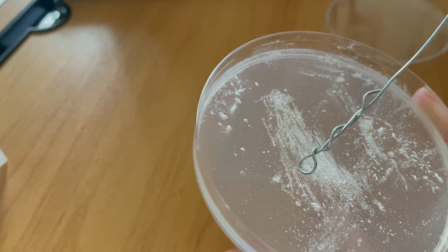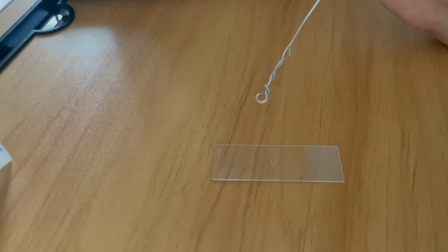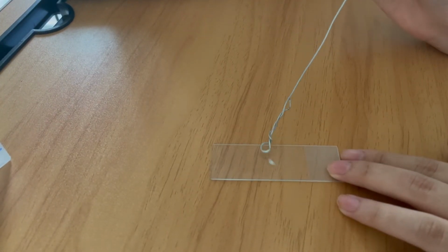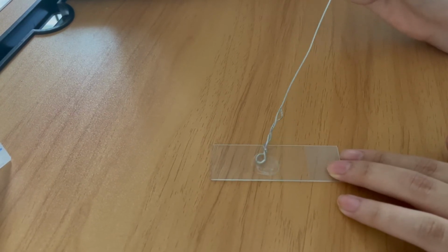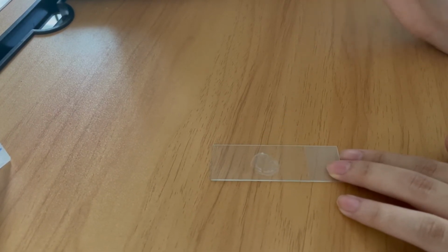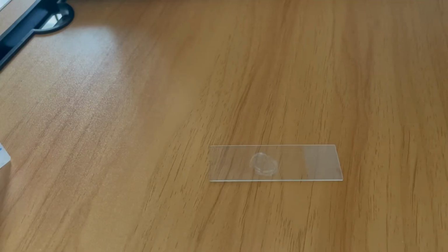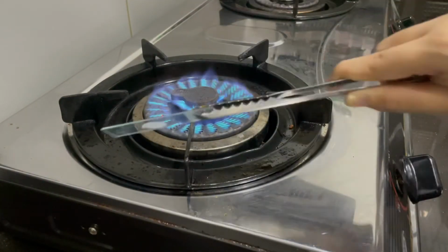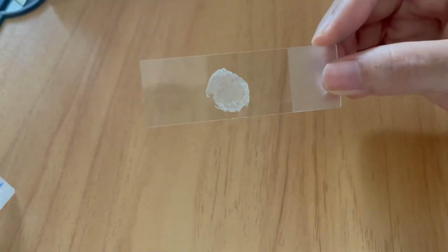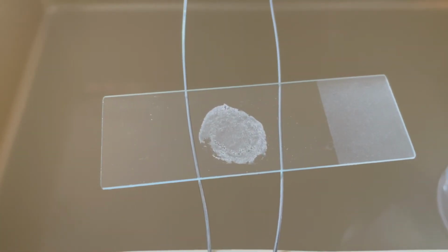A minimal amount of culture is required. If culture can be detected visually on the inoculation loop, it indicates the collection of too much culture. The organism and water were mixed, then spread by means of a circular motion of the inoculating loop. The smear was allowed to air dry and then heat fixed by passing the smear over the flame several times. Heat helps the cells adhere to the glass slide and prevents significant loss of culture during staining.